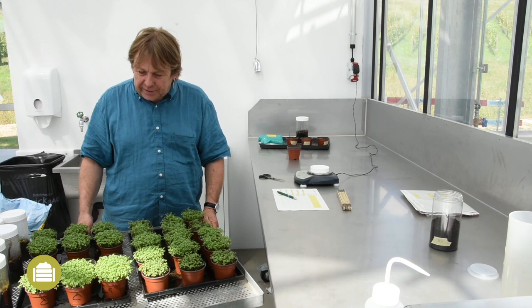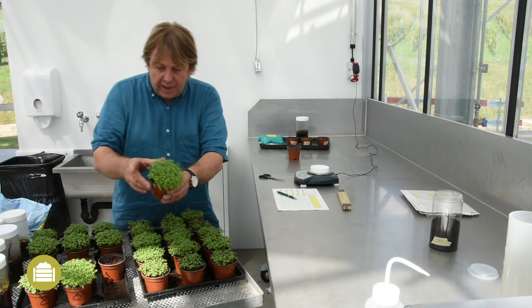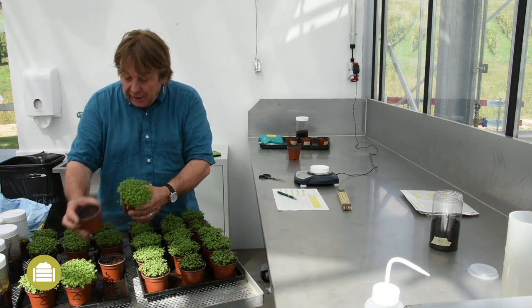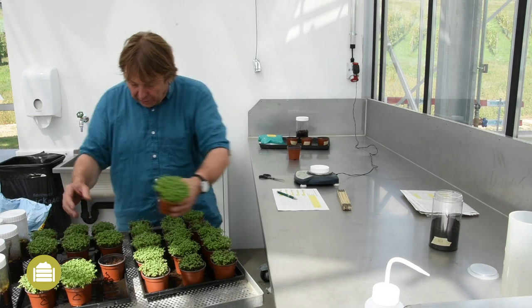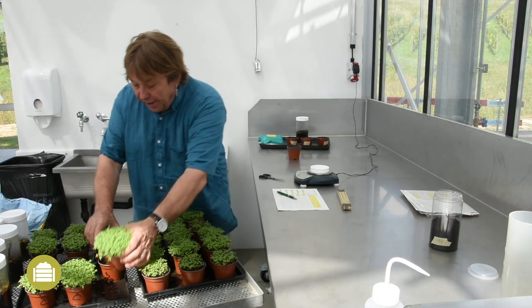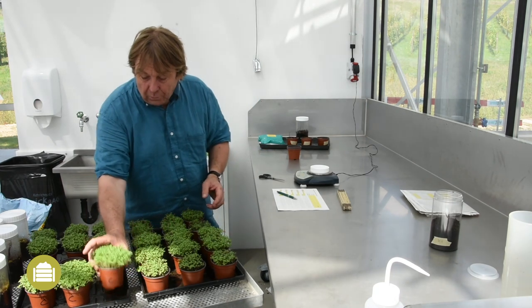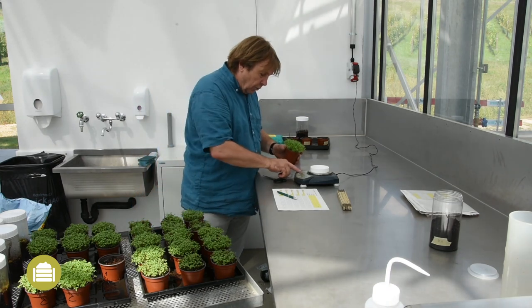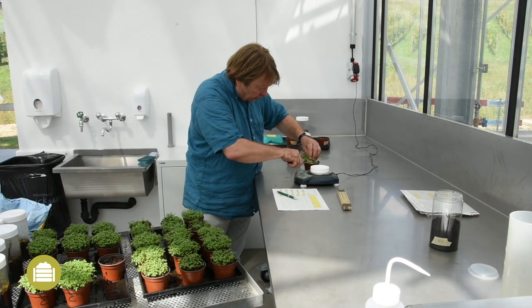Here are the plants after seven days of growth. As you can see, the cress on the reference substrate grew very well. In contrast, some composts, like this very fresh one, inhibited the growth of the cress. On the contrary, on a compost much riper, the cress grew quite well. For the evaluation of the open test, I measure the weight of the sprouts — I cut them at one centimeter above the ground.